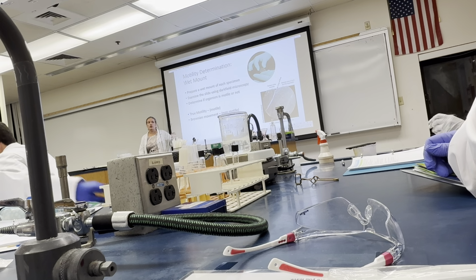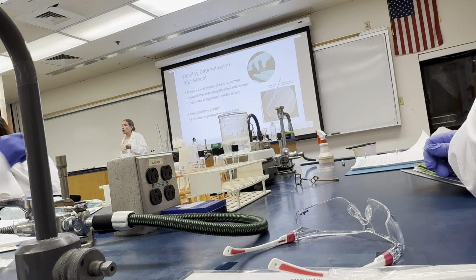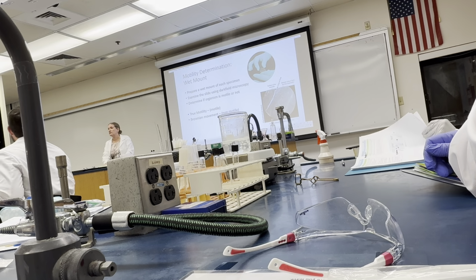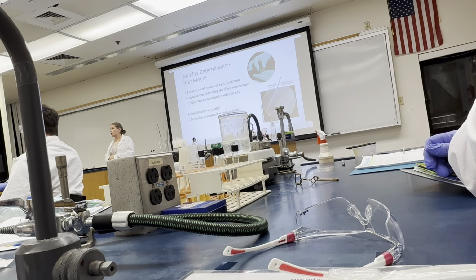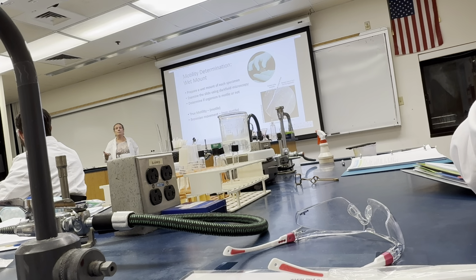When you're looking at these under the microscope, number one, the highest we'll go is 20x. You don't need to go higher than 20x. You're not putting oil on your cover slip, okay? You look at it at 10, bring it up to 20. If you're calling me over to take a look at it, make sure you're seeing what you're supposed to see, which is perfectly fine. That's where I want to see it, at 20x.